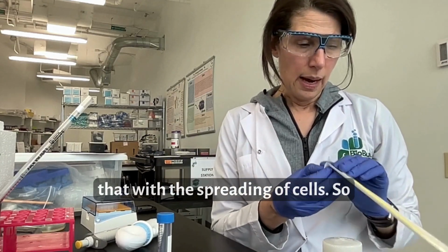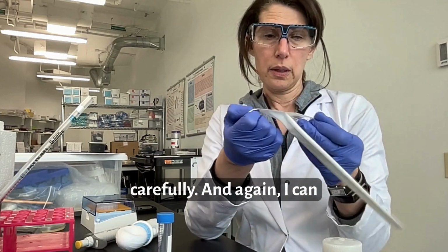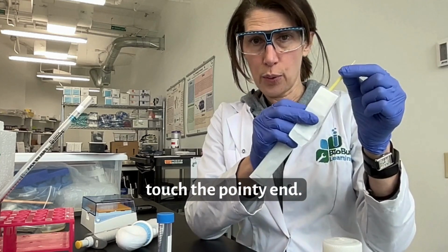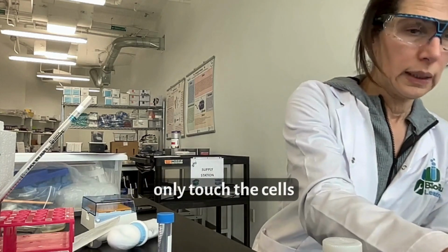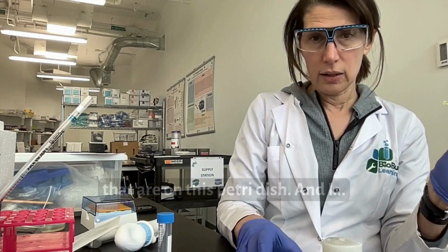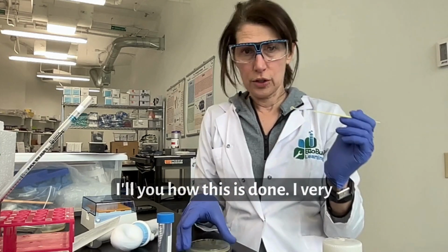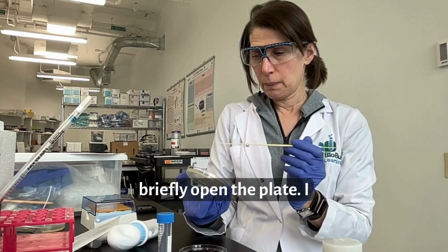So I'm going to open this loop carefully, and again, I can touch the pointy end, but the loop itself needs to only touch the cells that are on this Petri dish. And I'll show you how this is done. I very briefly open the plate.